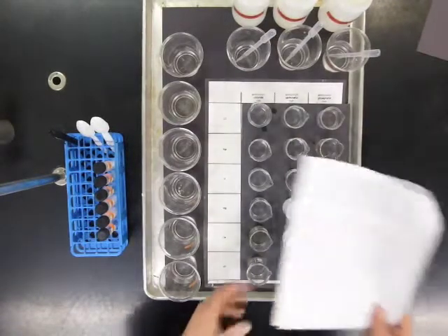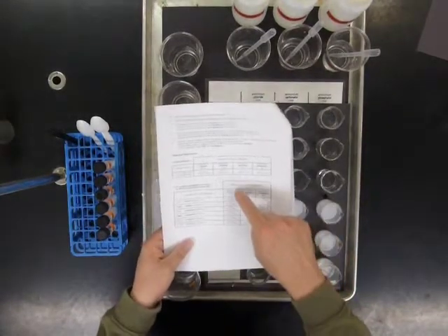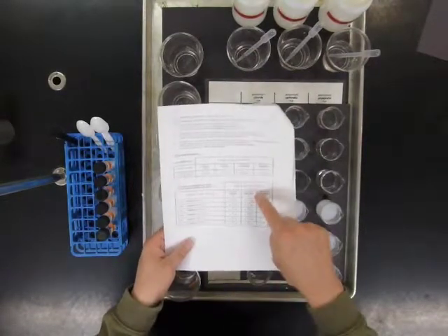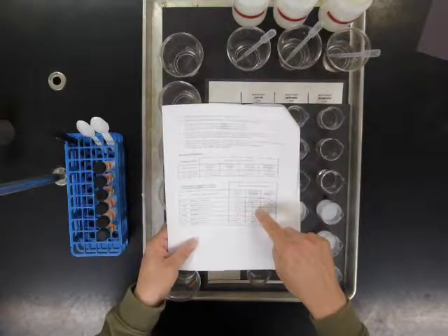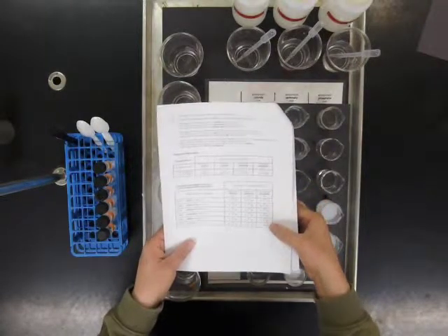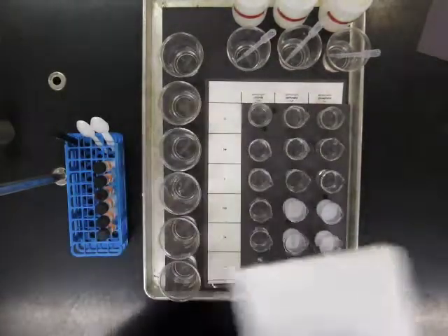So on your data table, make sure that you circled for the chloride reactions, that there were no reactions among any of the 6 substances that we tested. For the ammonium carbonate reactions, that the first 3, lithium, sodium, and potassium, no reaction, the last 3 a reaction. And for the ammonium phosphate reactions, only reactions with magnesium, calcium, and strontium. Next, we'll take a look at the results and what they mean.